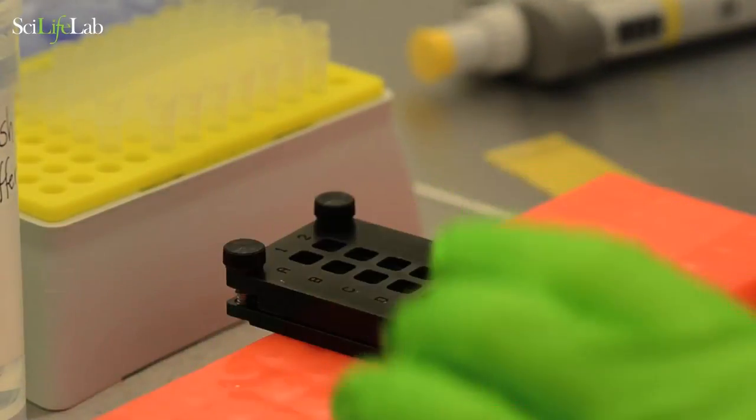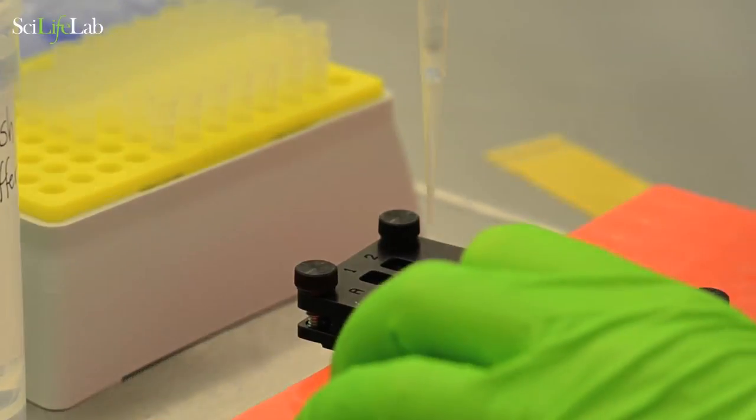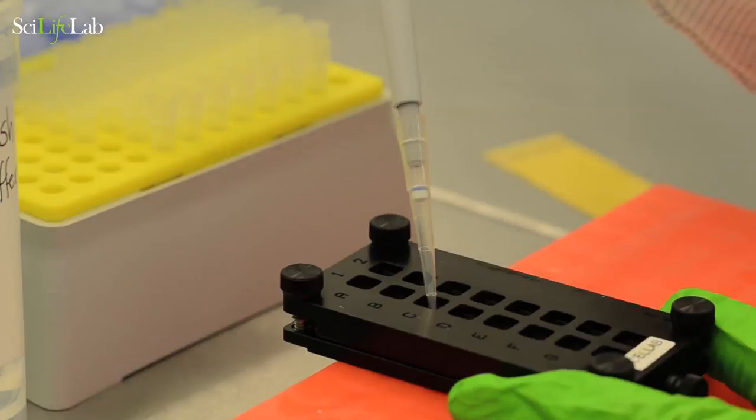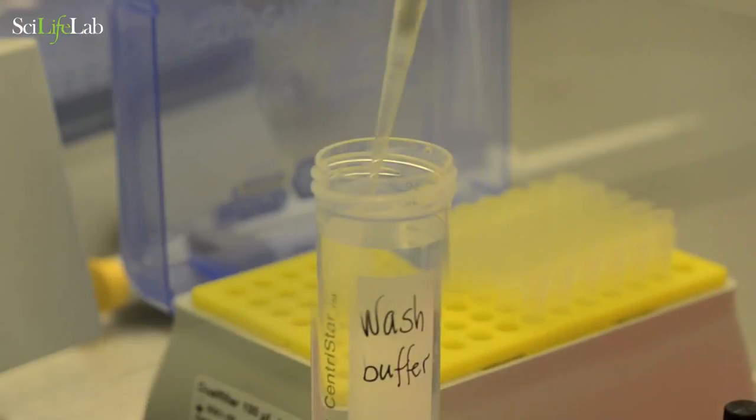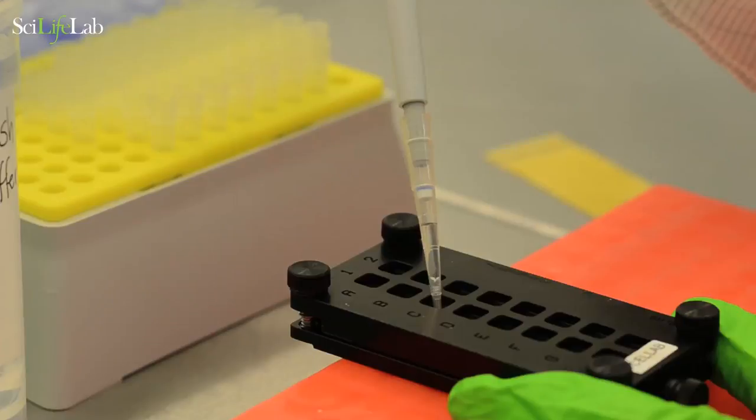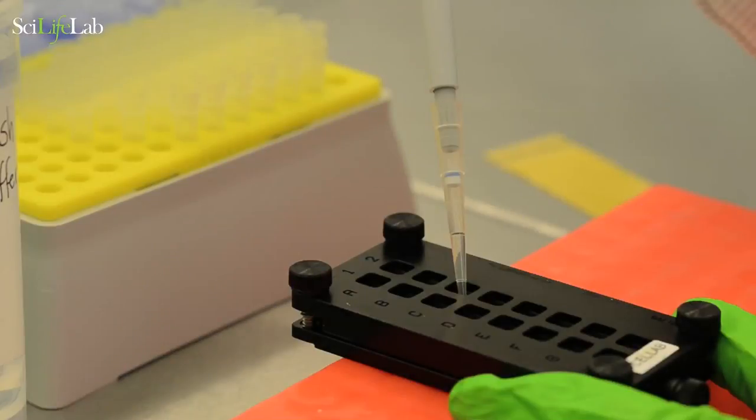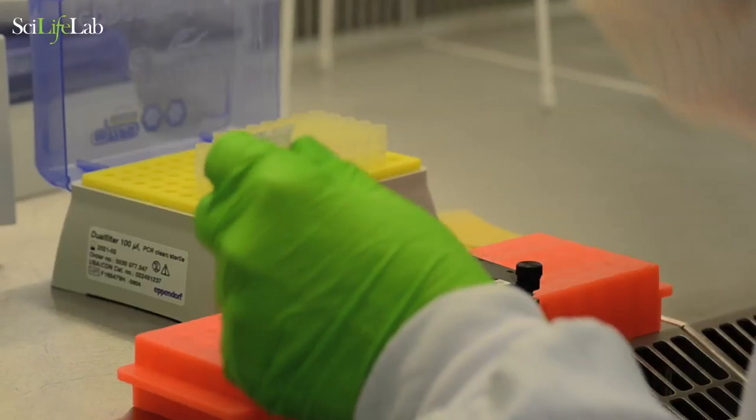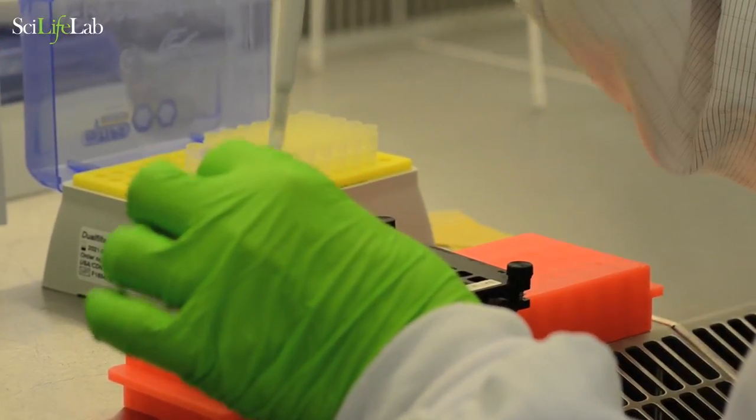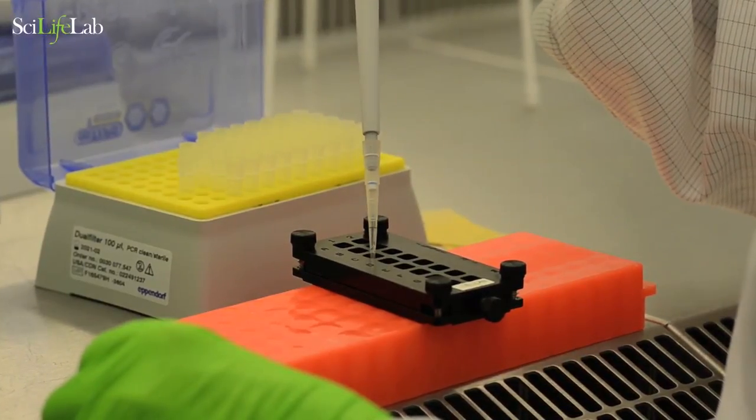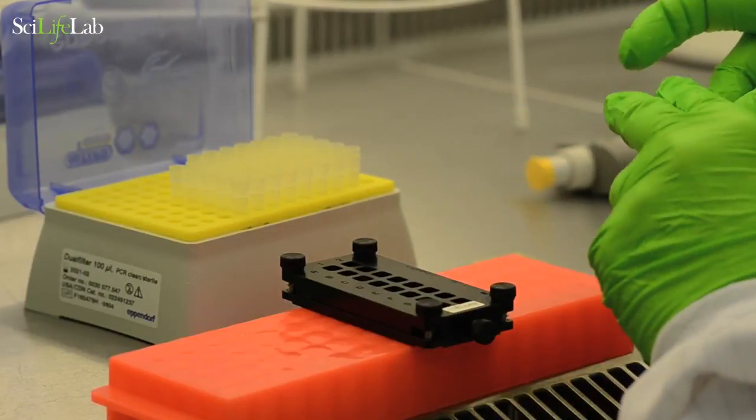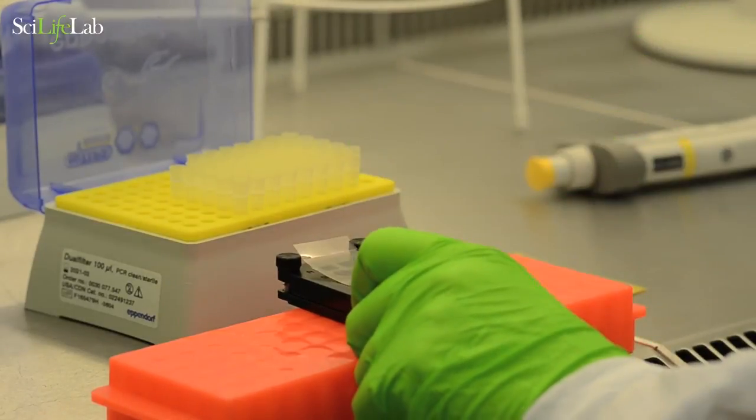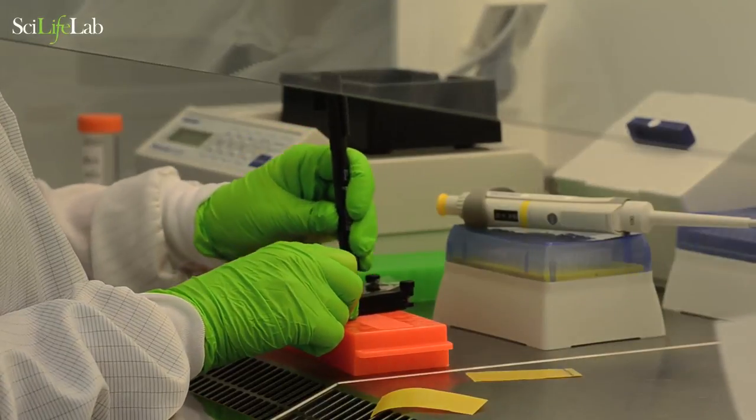Remove the seal and remove the pepsin very slowly. Wash the wells carefully. Add the pre-warmed cDNA synthesis mix. Seal the cassette and incubate overnight at 42 degrees.